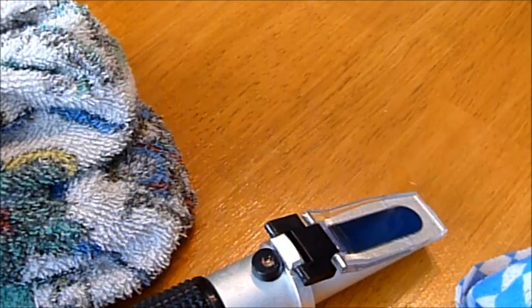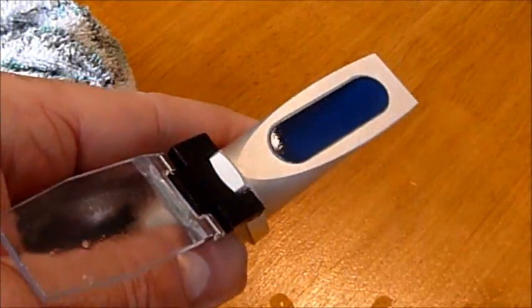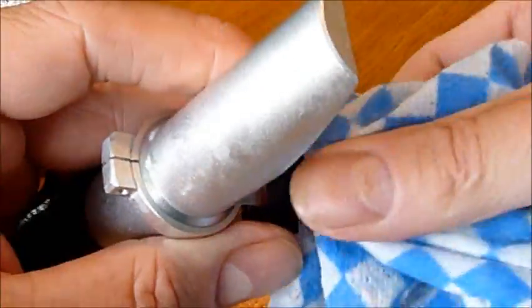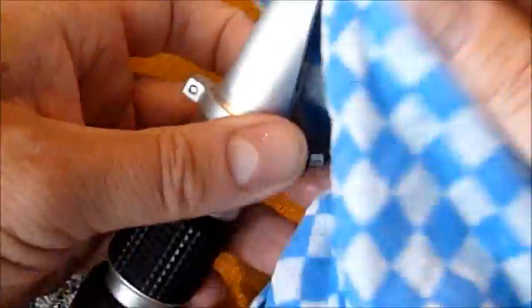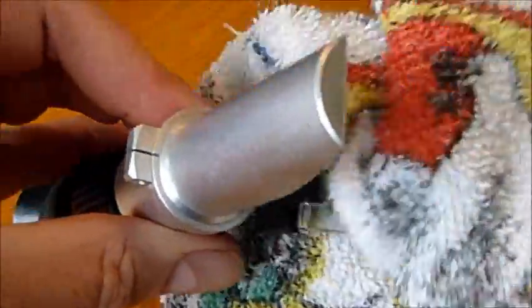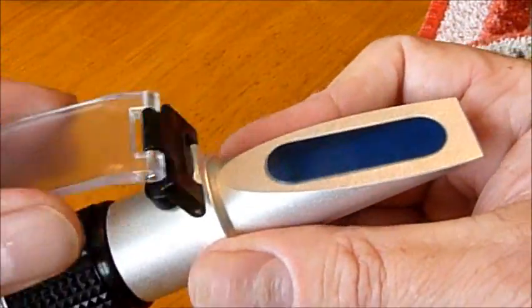Your final task before you've finished is to clean the refractometer. Use warm water and make sure that you've very effectively removed all material from the prism and the prism cover. Vitally important that you don't have anything left over. And it's also really important that you clean and dry it immediately because you don't want any film of calcium salts or similar from the water to build up on the prism. You want to make sure that you've got a good contact between your sample and the prism there.